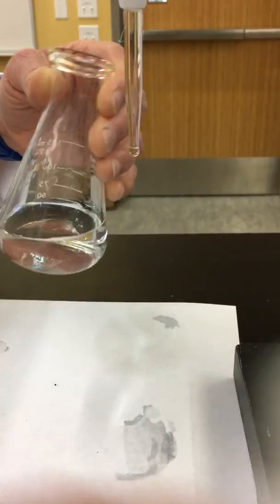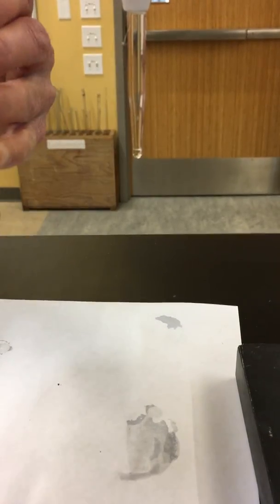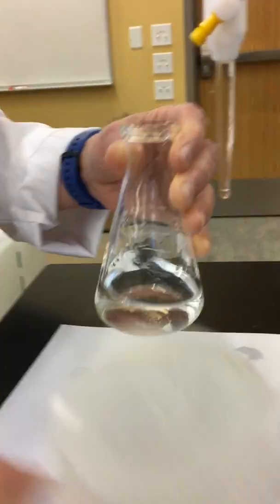So I'm just going to rinse it down to make sure no sodium hydroxide or HCl is on the sides of the wall.